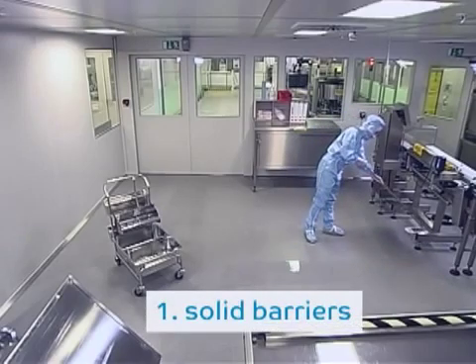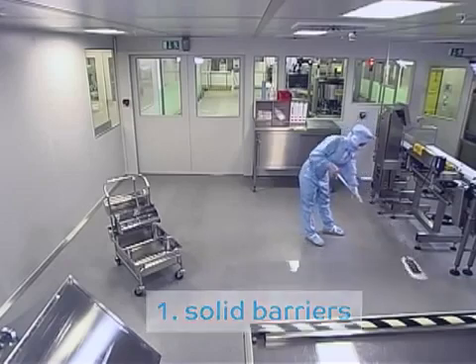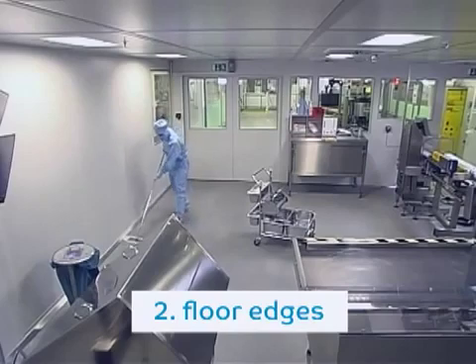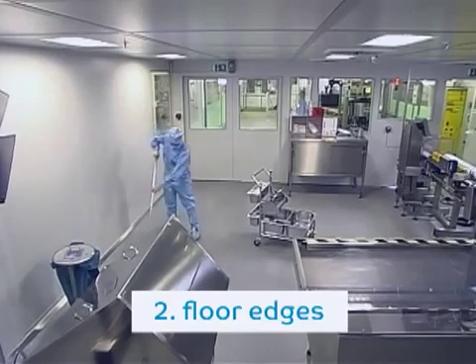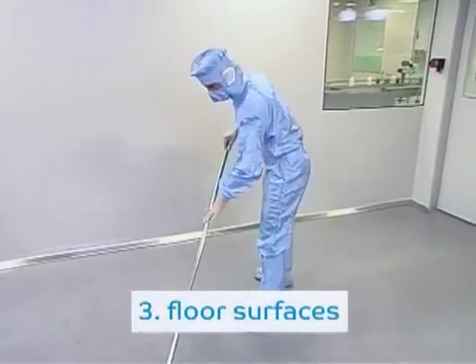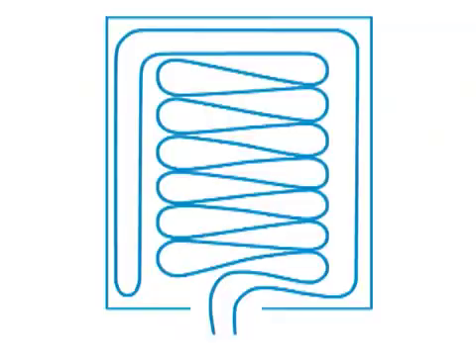Start wiping solid barriers, such as machines, and wipe around them. Continue with floor edges. Wipe in a line along the wall up to the most distant site of the room. And from there, start wiping the floor surfaces, moving backwards and in a figure of 8 shape. Here you can see the wiping principle, taking an approximately 10 square meter room as an example.